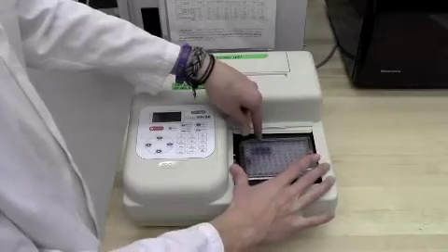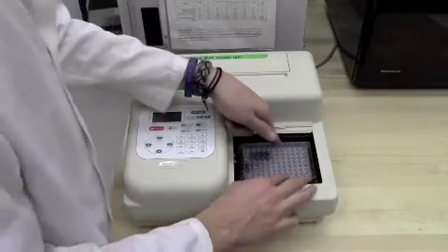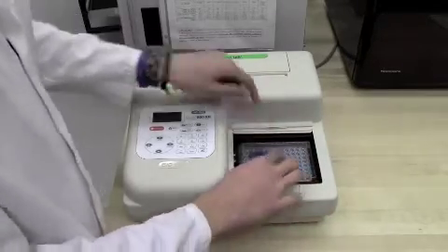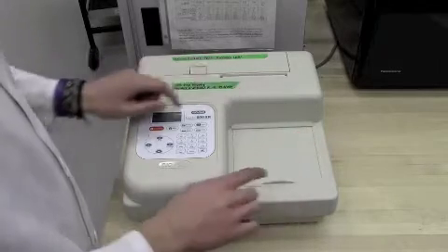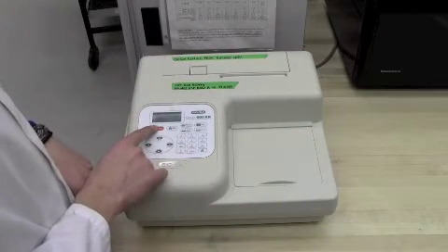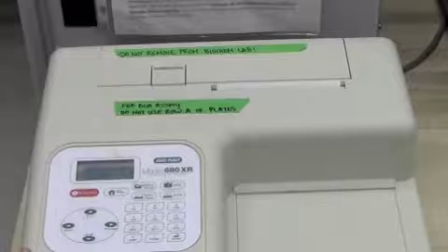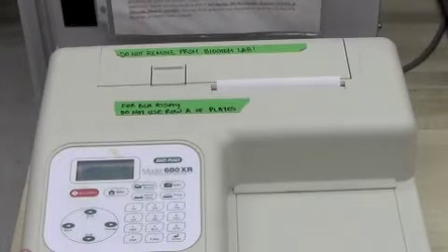Place the plate in a microtiter plate reader set to 560 nanometers. Press down firmly, close the lid, and press run.